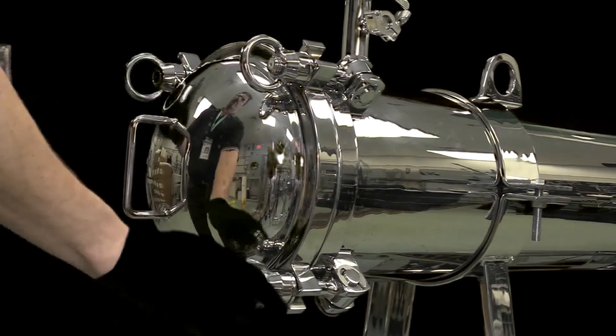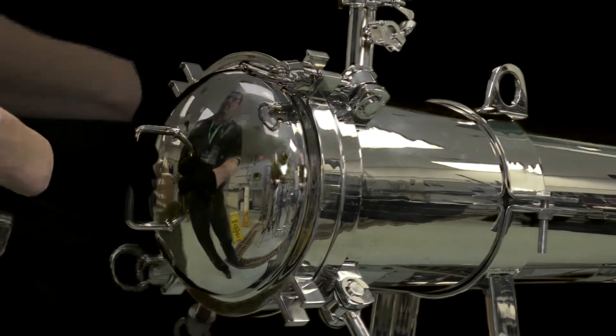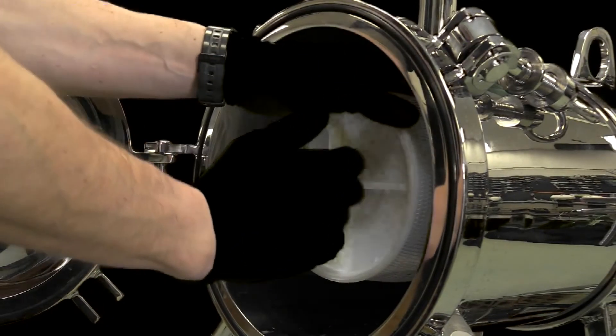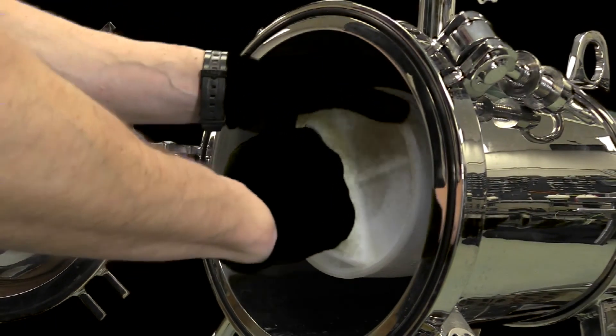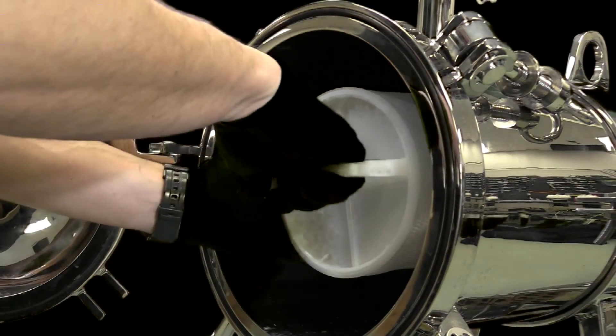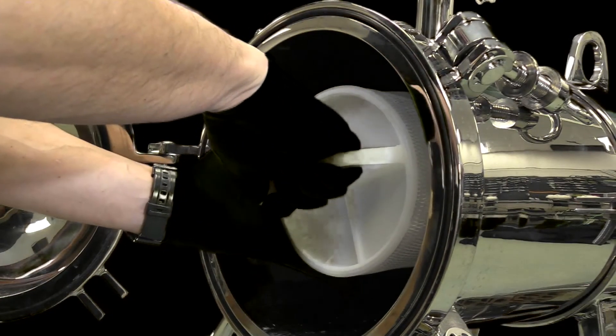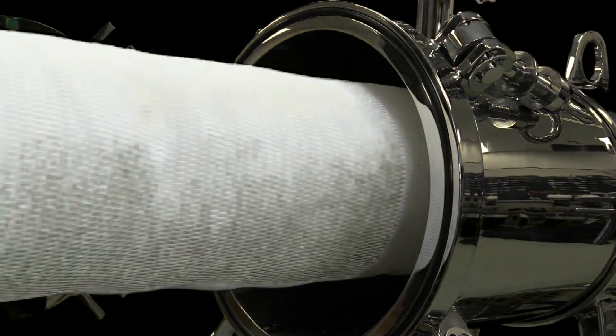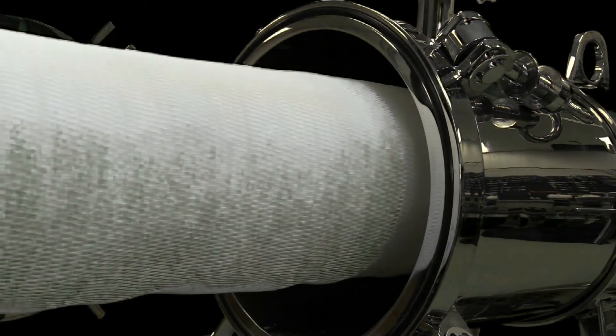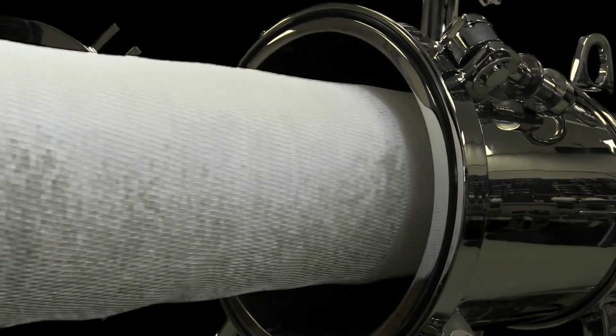When testing is complete and after draining the housing, loosen the four clamps on the housing lid. Swing the housing lid open. Grasp the filter handle and turn in the counterclockwise direction until no longer possible. This will occur after roughly one quarter turn. The filter is now disengaged from the seating mechanism and can be removed from the high-flow filter housing.